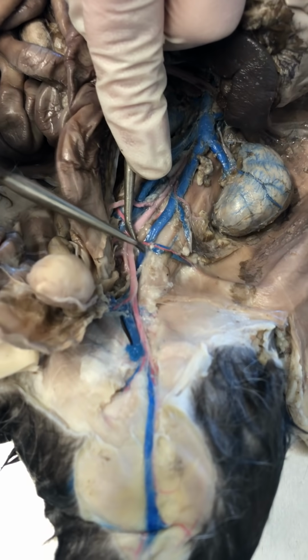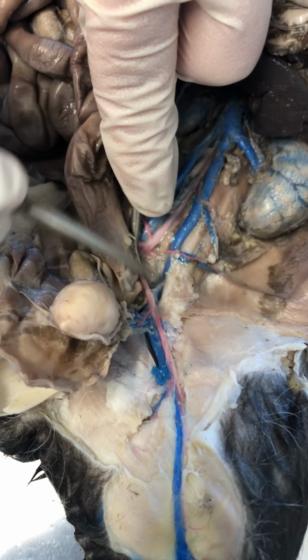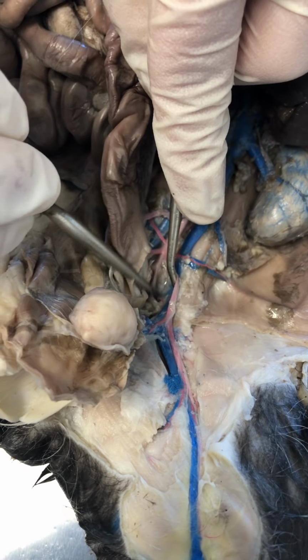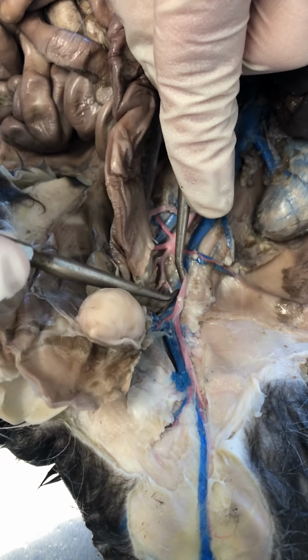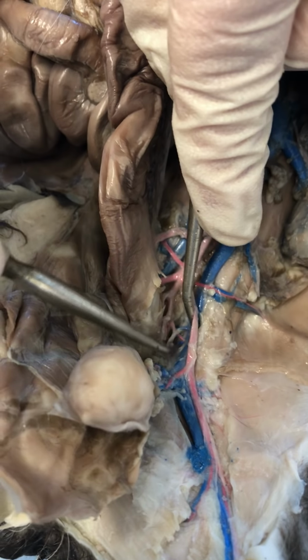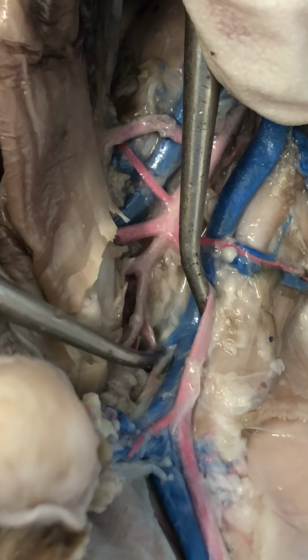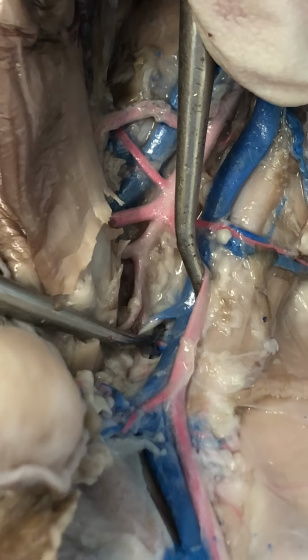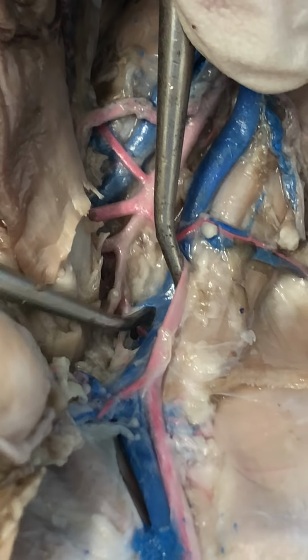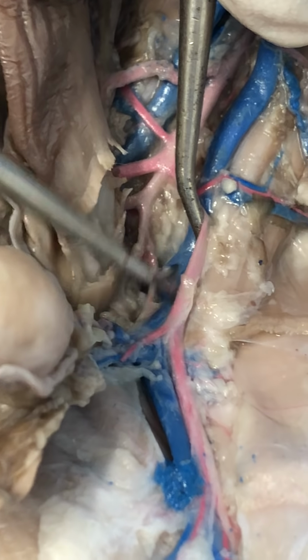Okay, so starting here will be my common iliac moving down. So it's common iliac first. Then if I move some of this to the side, we see this deep inner branch. Okay, see that going deep down into that tissue down there? Okay. Right there. The probe's running with it, see that? That is my internal iliac. Okay, so it's common up here. We have this internal branch. So after that, this little portion here is now external iliac.